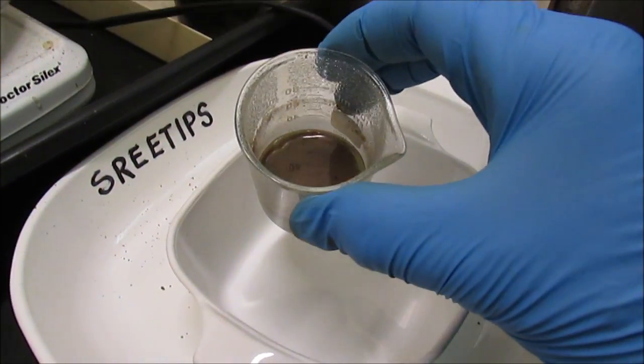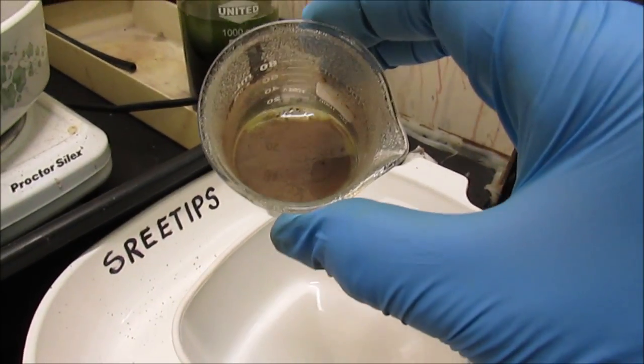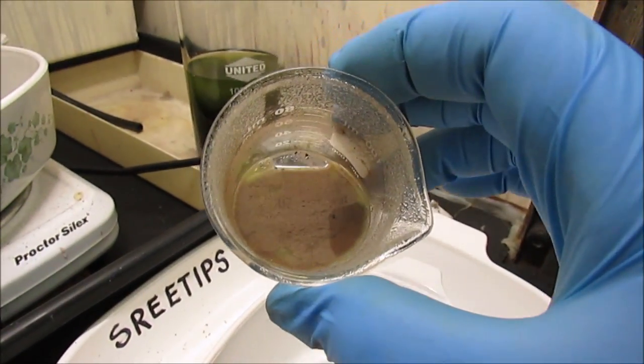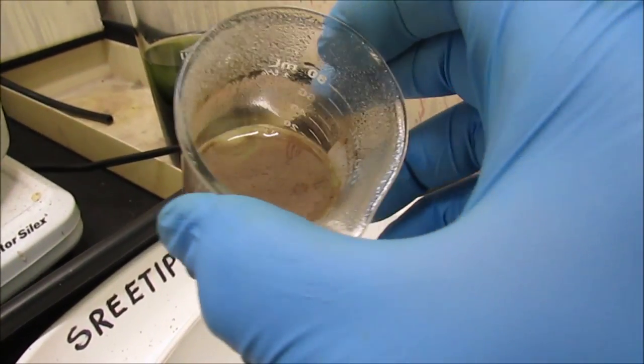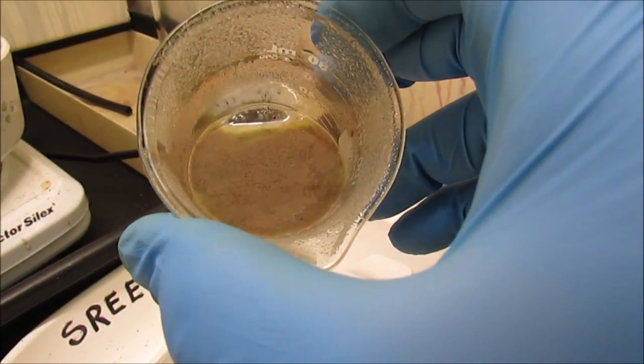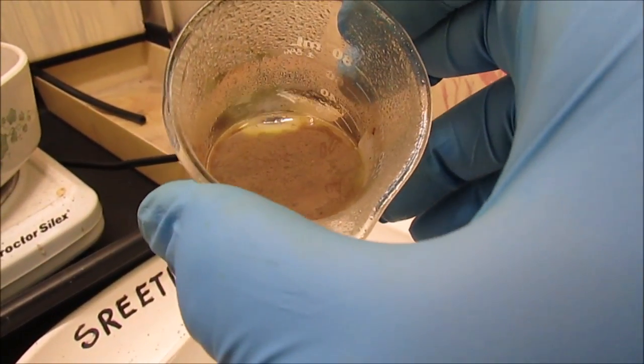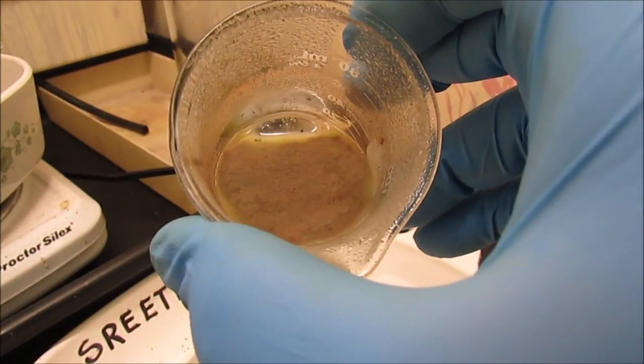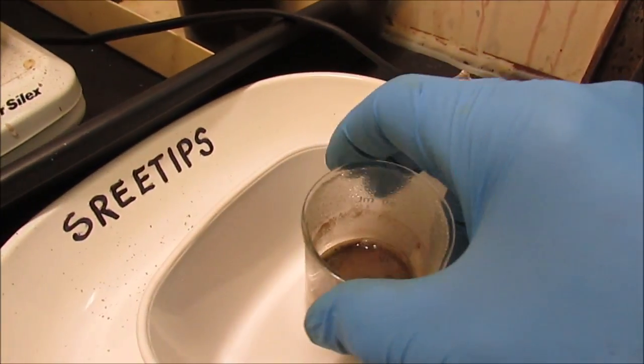I've added the piranha solution, and you can see down at the bottom there, there's some black material in the bottom of that beaker. I don't know if that's tin metal or not.